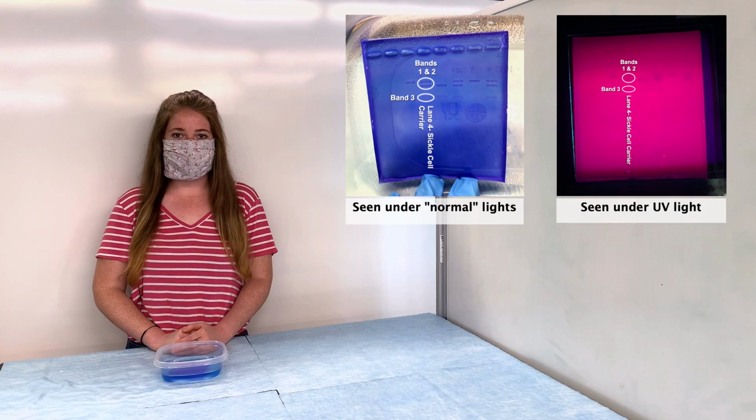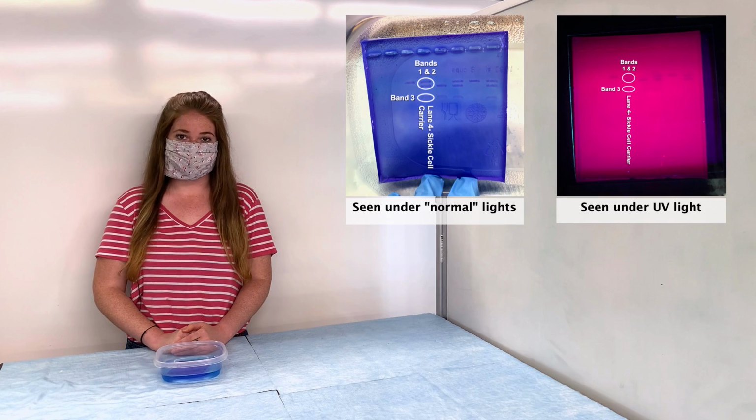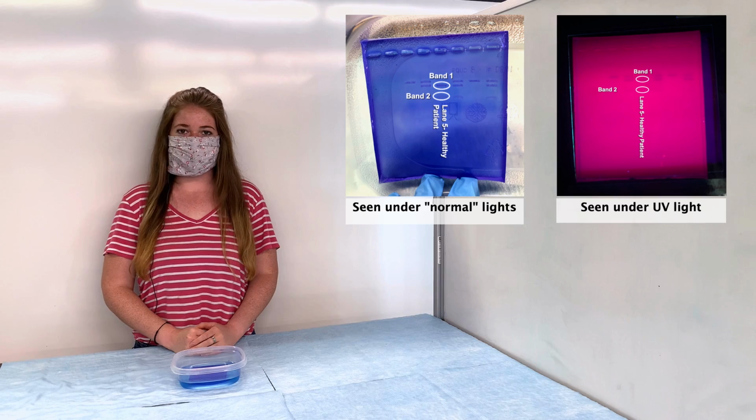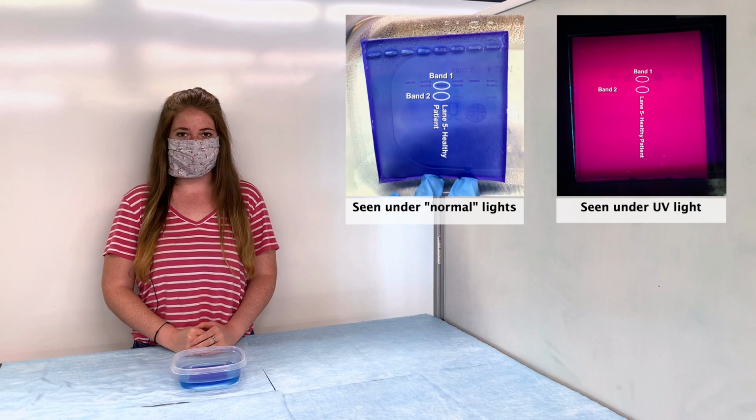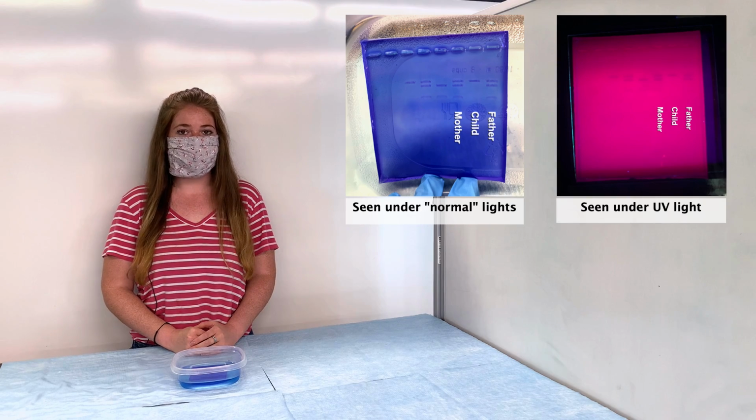In lane 5 was our healthy individual that neither carries nor expresses sickle cell, and their DNA resulted in 2 bands. So now we just need to look at mother, child, and father. We will know what their sickle cell status is by comparing their unknown banding patterns to our known banding patterns and seeing which ones match.